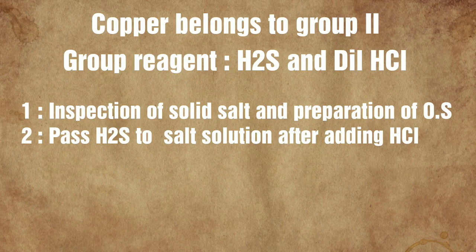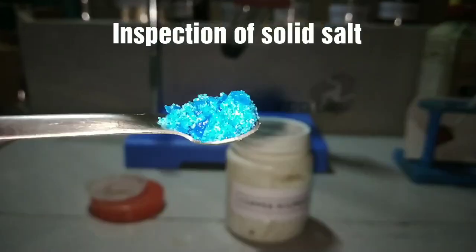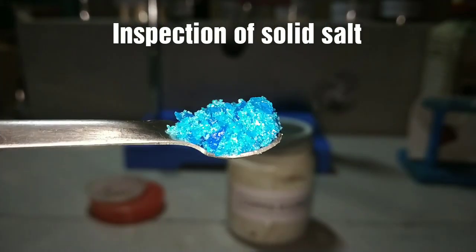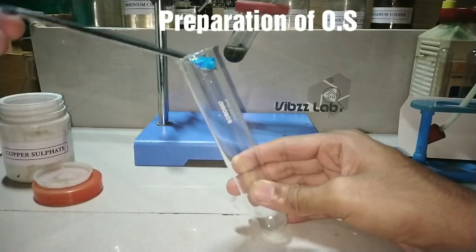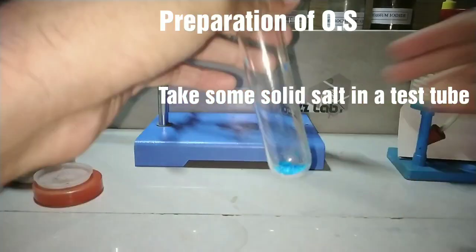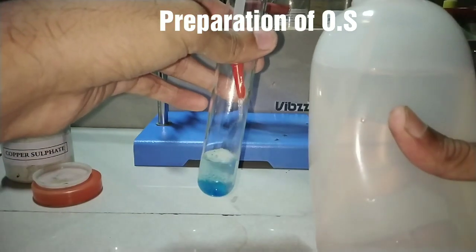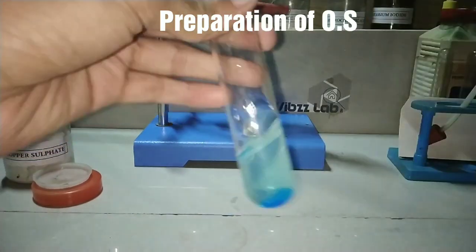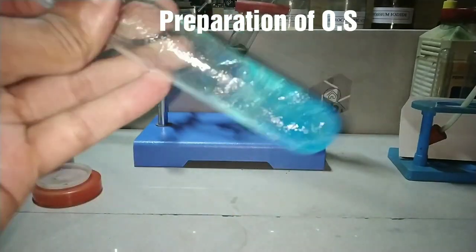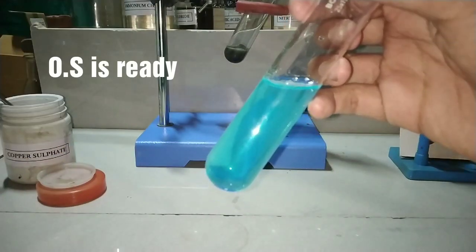First of all we inspect the solid salt and prepare the original solution. The solid salt appears blue in color and it is crystalline in nature. The original solution for copper can be very easily prepared by dissolving some of the solid salt in distilled water, and you get a blue colored solution. The blue color is due to the partially filled d orbitals of the copper. And the original solution is ready.